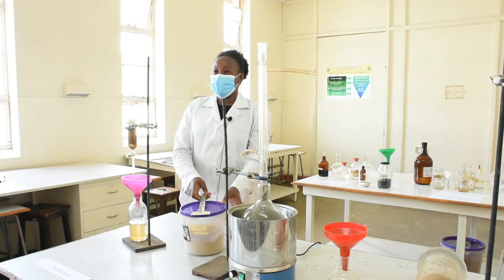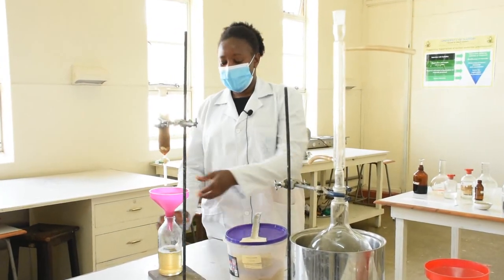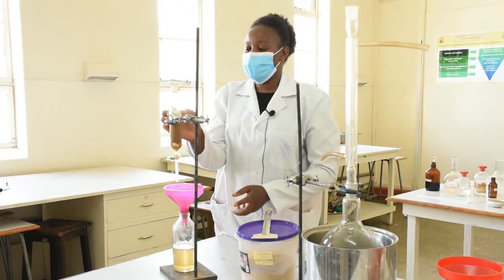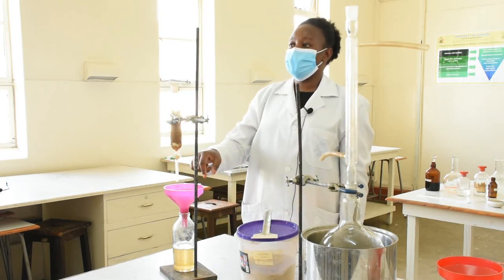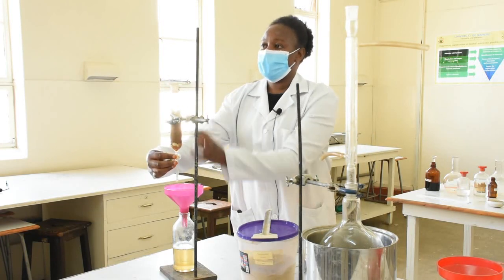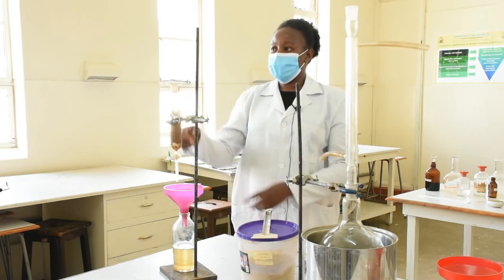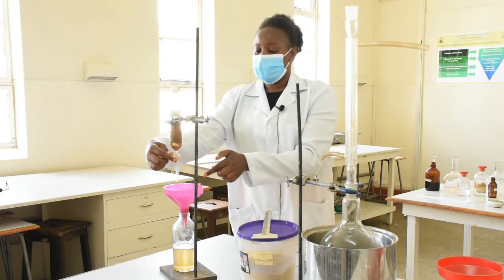In percolation, we take the dried powder sample, pack it in a column, then run an organic solvent through the powder material and seal it. We let it run through, keep adding more solvent until what we collect is clear — showing that we have exhaustively extracted the phytoconstituents. Pack the column, run an extracting solvent, and keep adding until the eluent is clear.